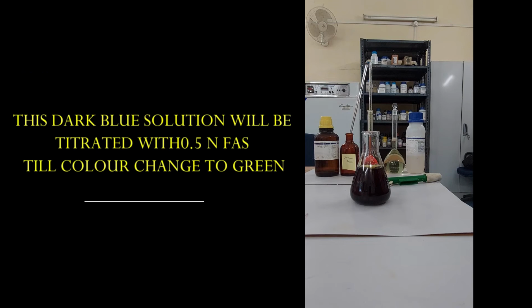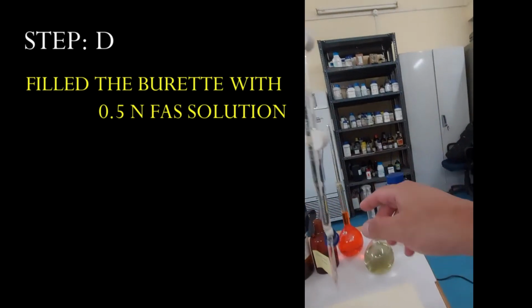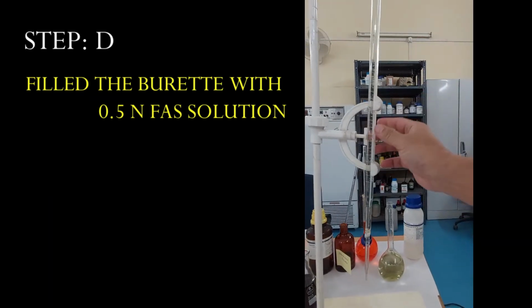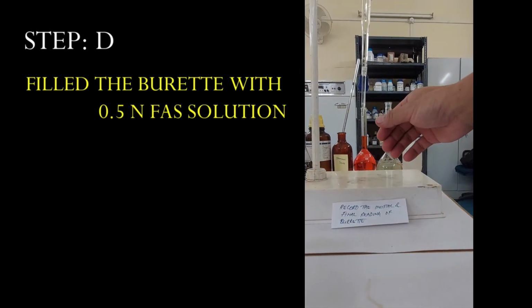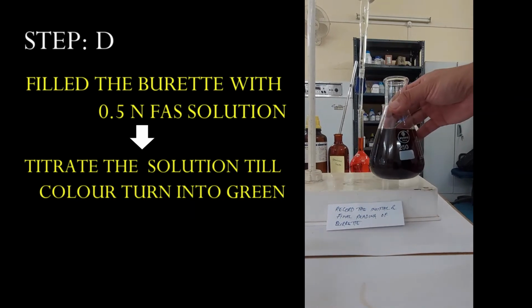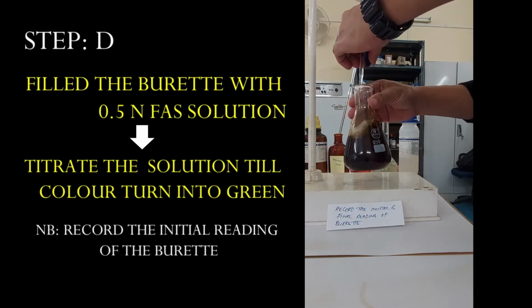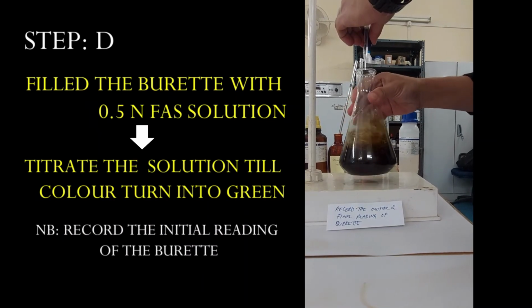Next, this dark blue solution will be titrated with 0.5 normal ferrous ammonium sulfate till the color changes to green. To do so, first fill the burette with 0.5 normal prepared ferrous ammonium sulfate solution and then titrate the solution till the color changes. And remember to record the initial reading of the burette.